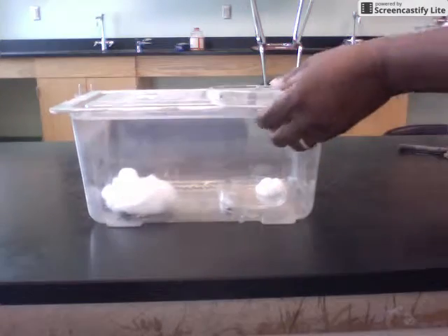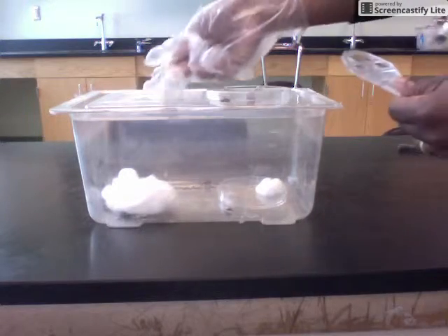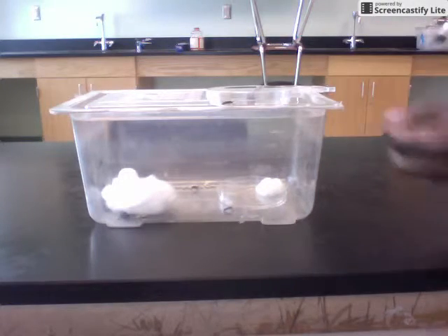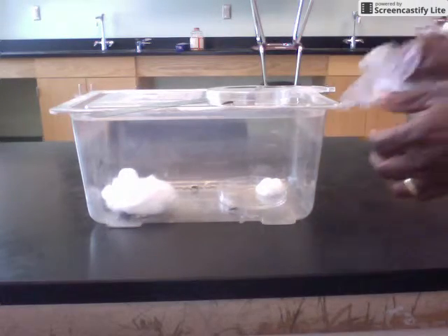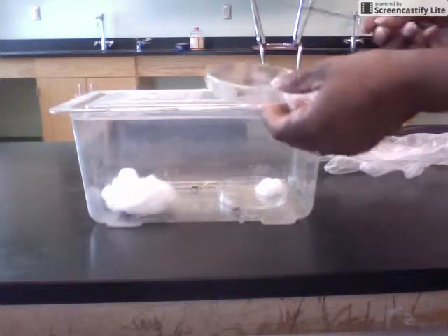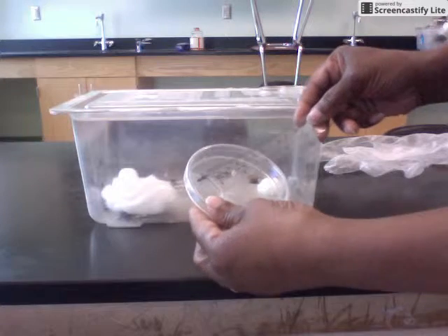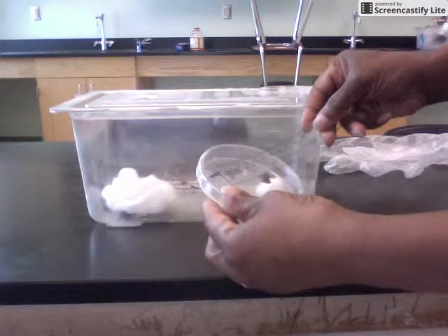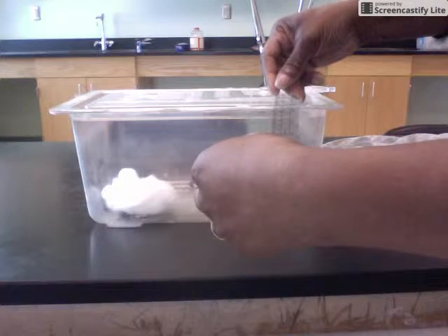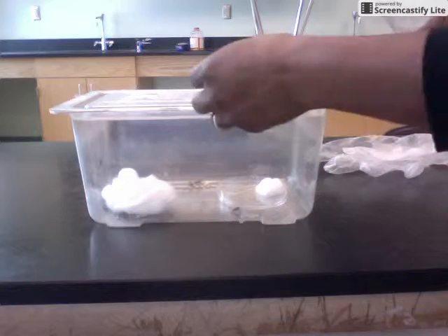Once you've done that, make sure students have a hand lens and a ruler. The reason is because you want them to collect quantifiable as well as qualitative data. I ask students to try to get some measurements of the milkweed bug. This milkweed bug is about 1.3 centimeters in length and about 0.4 centimeters in width.